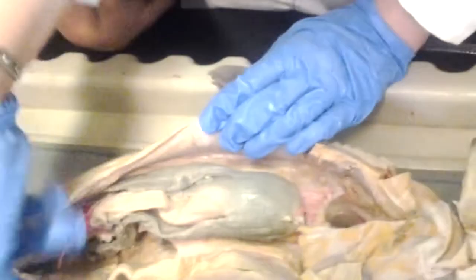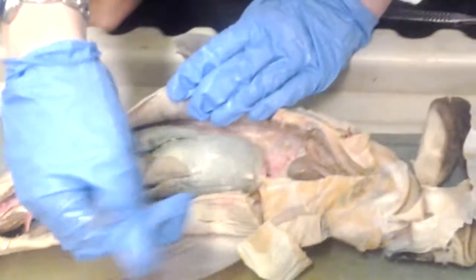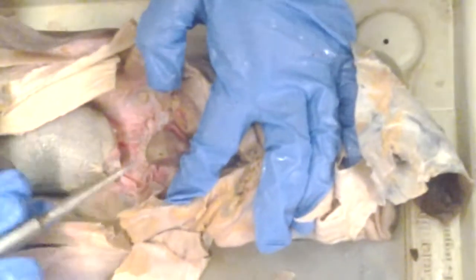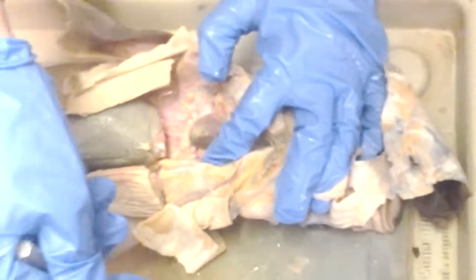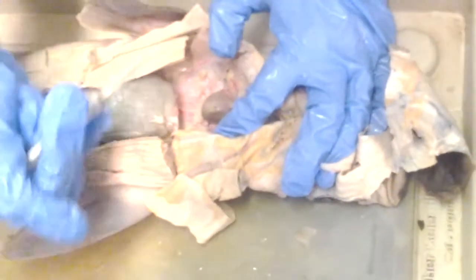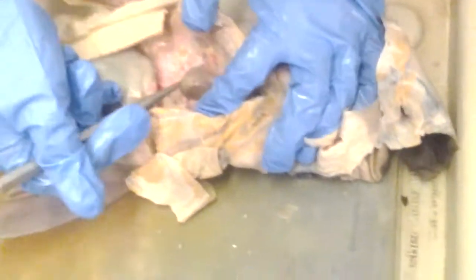Hold on. Do you have those, subclavian, jugular? Subclavian, jugular. Yeah, okay, because you can't really see them at all. Brachial, subclavian. People in Dr. Wallard's class, did you see those? The jugular and the subclavian. Did you see those? Should we look at another chart just to make sure you can point them out? You don't need to know them, because they're tiny. You're not going to see them.